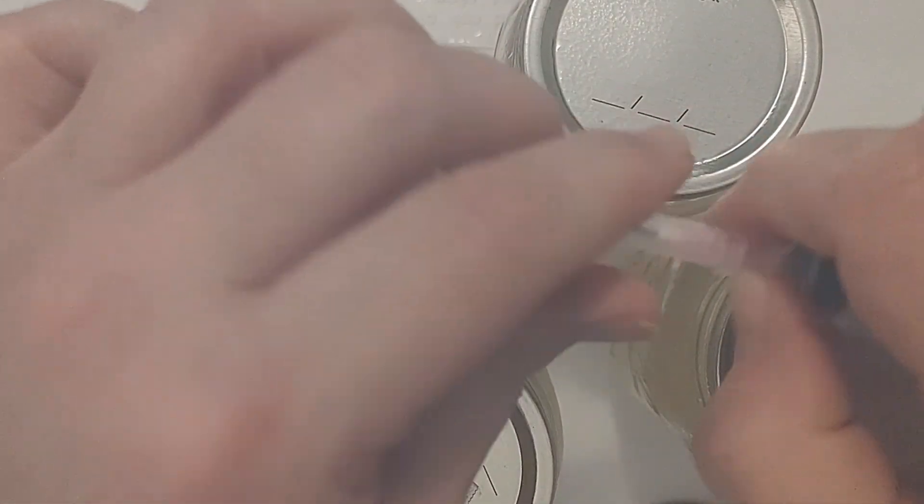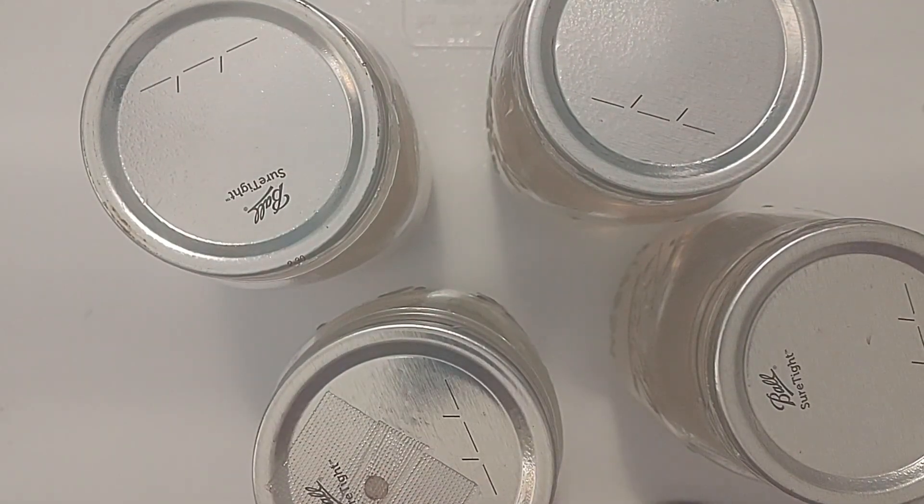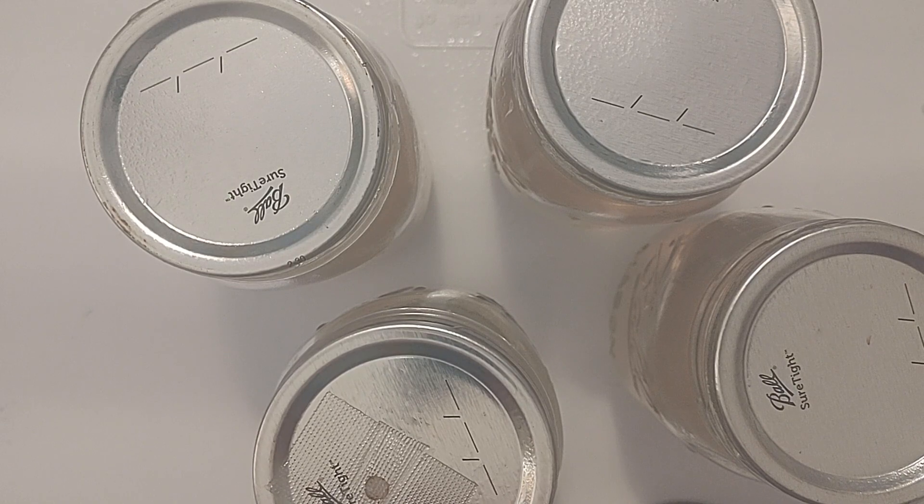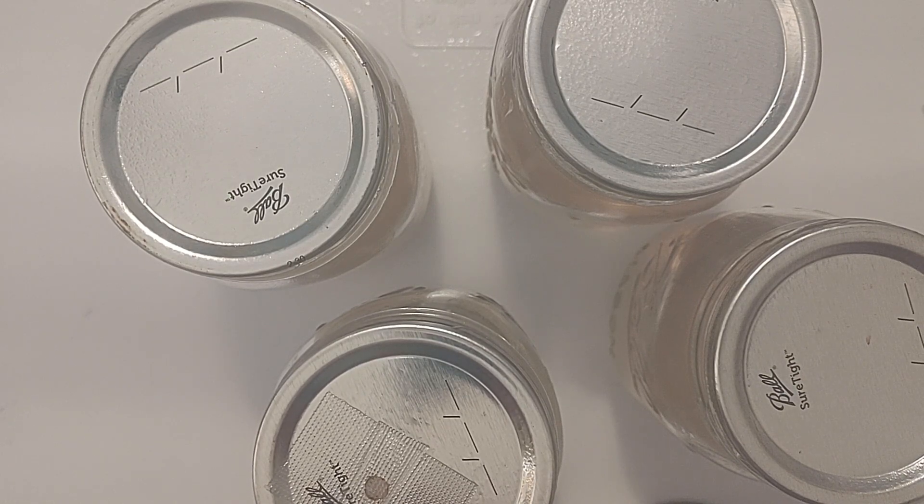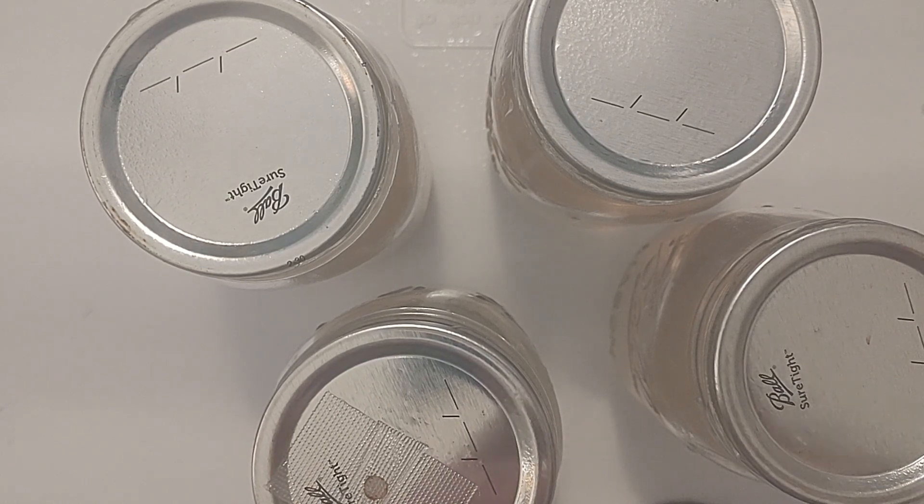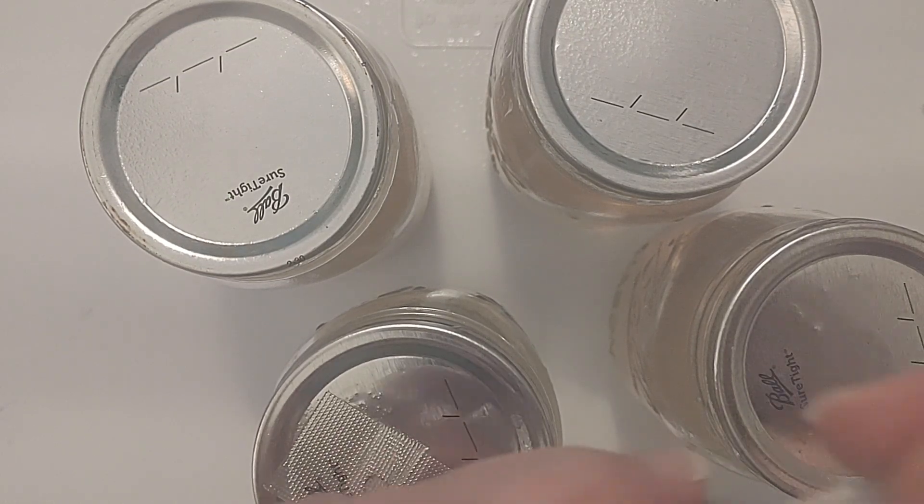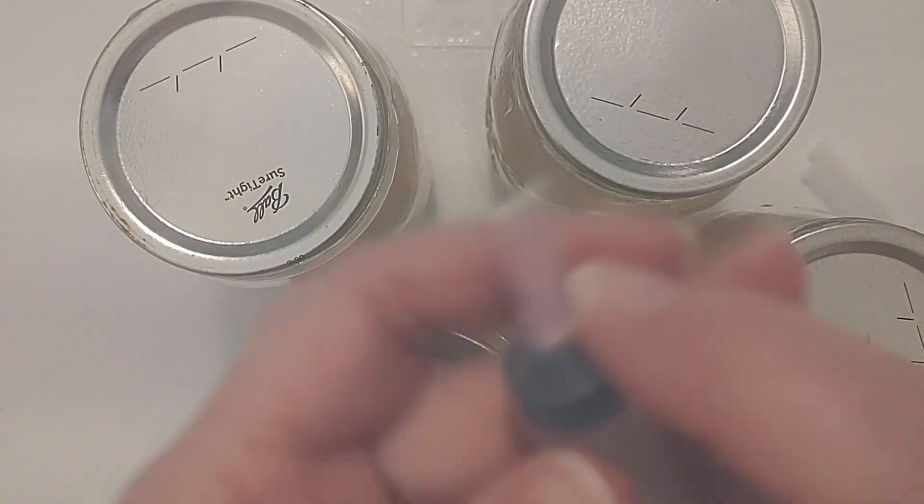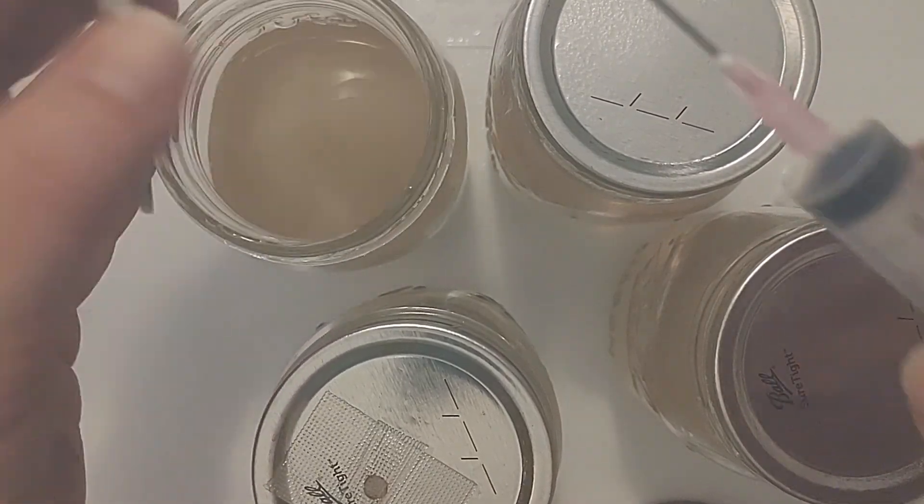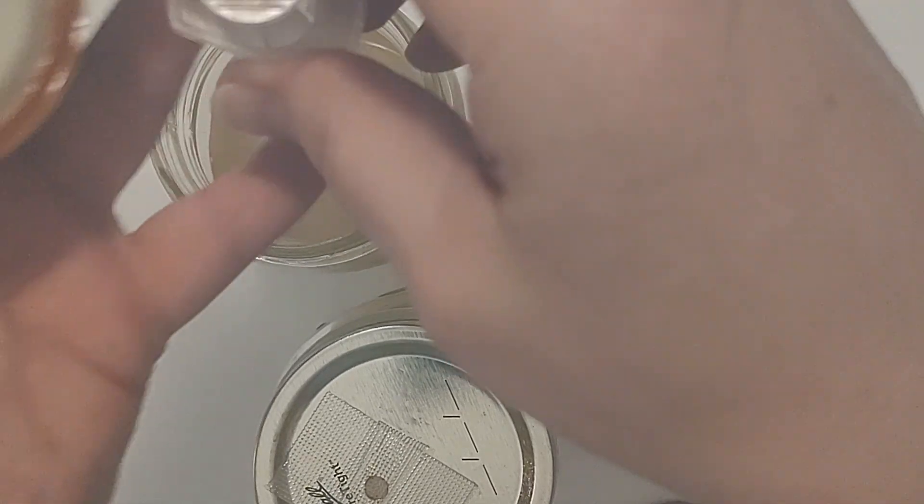So we're gonna go fast taking off this syringe cover. We're just gonna go in, grab a syringe and put it in the new liquid culture. So here we go, we're gonna go fast.